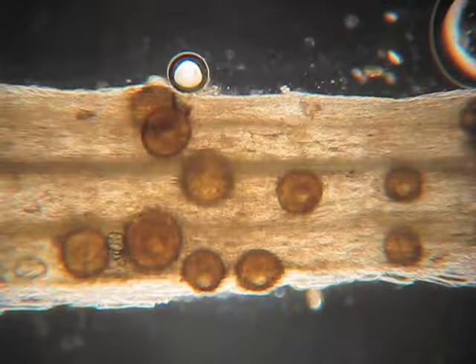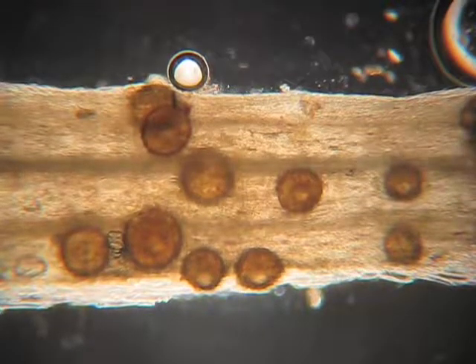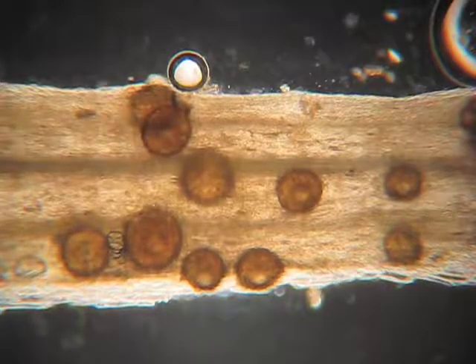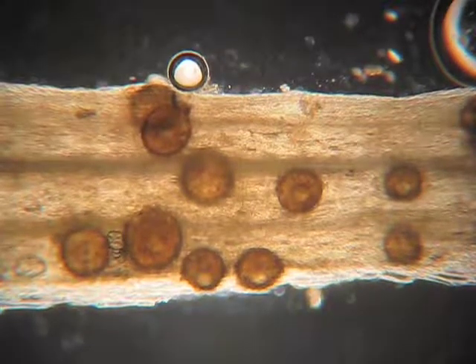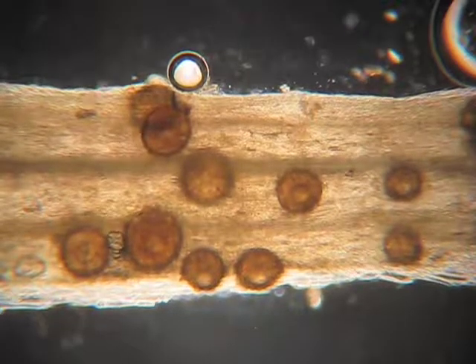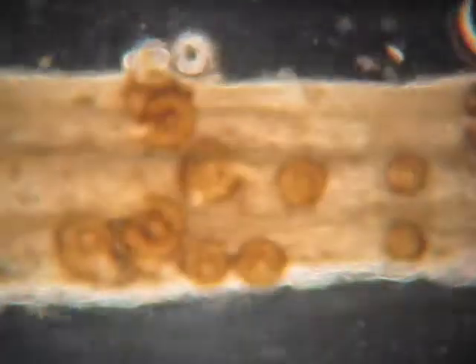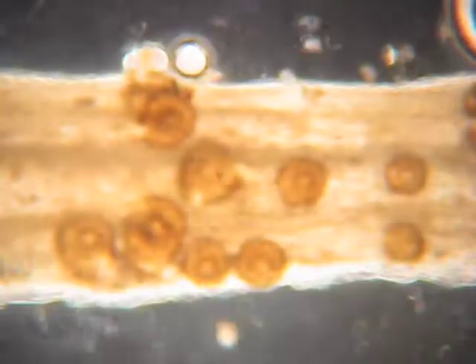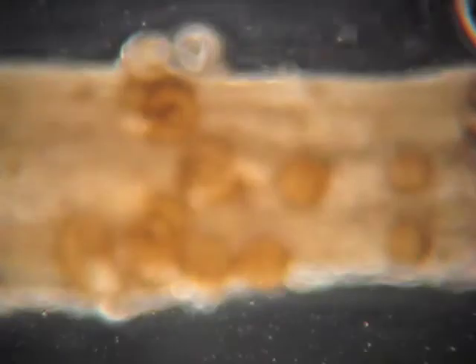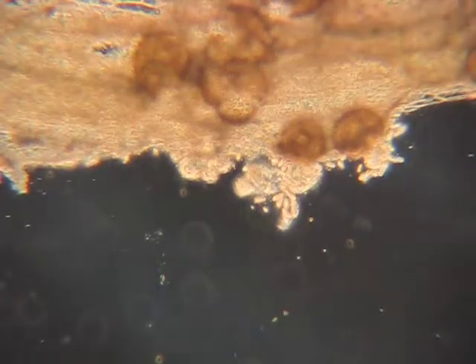Now what I'm going to do, and I'll show you these flask-shaped structures, is press on the microscope slide with a pair of forceps and see if we can push out the spores and the sac that holds the spores, and we'll discuss that in a second. Let's see if I can get this to work. Here we go. There's a little bit of trouble to get those out of there, but here we go. We can see them a little bit now.